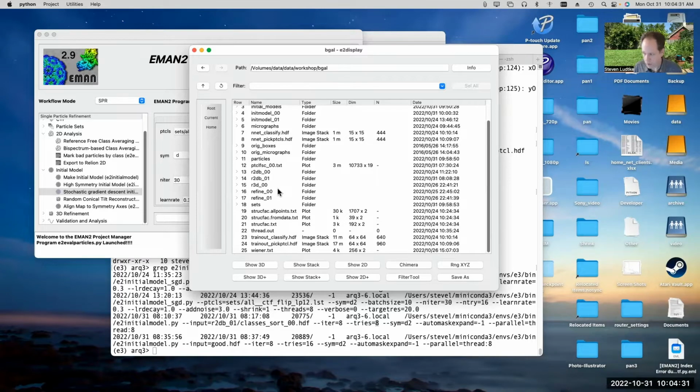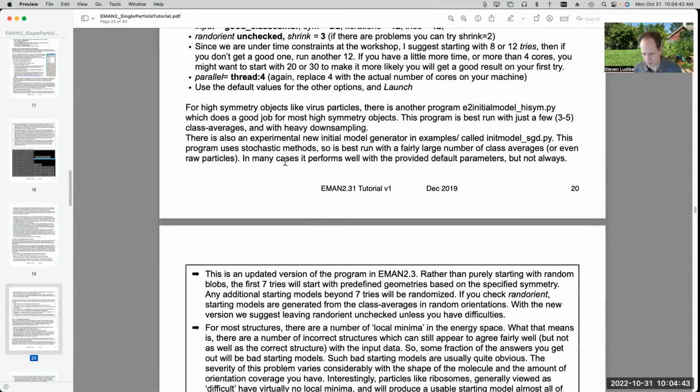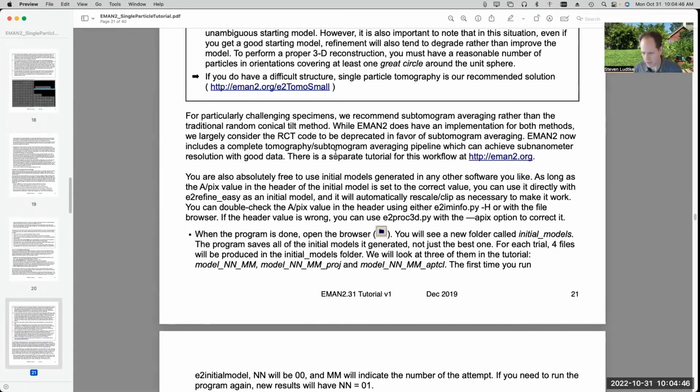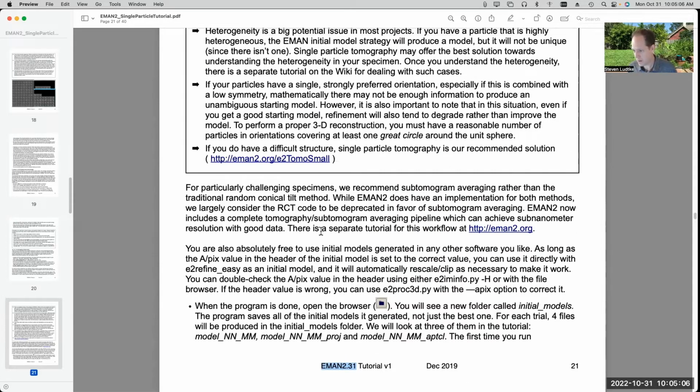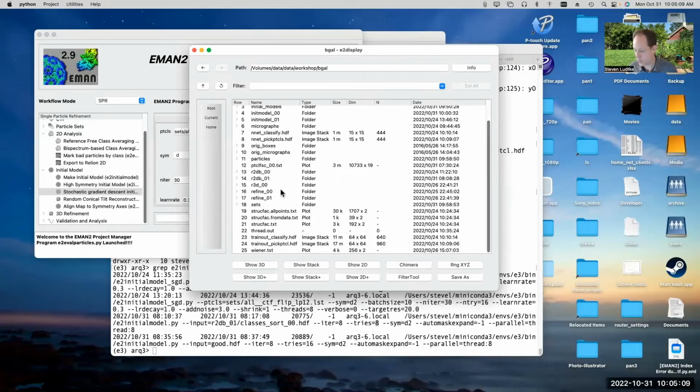My refinements didn't go wrong, so I won't have a lot of great examples of that to talk about today, but I did the 3D refinements in two different ways. The tutorial doesn't talk about the new 3D refinement strategy yet. This tutorial was last updated for EMAN 2.31, and the new refinement program first existed in the 2.91 release from last year, and has been improved since that time. So we haven't added it to the tutorial yet, even though it's probably the thing that you want to use moving forward if you're going to do single particle refinements anyway.